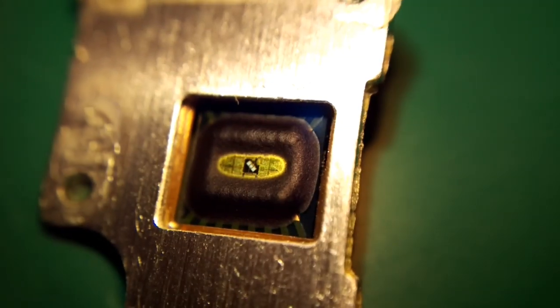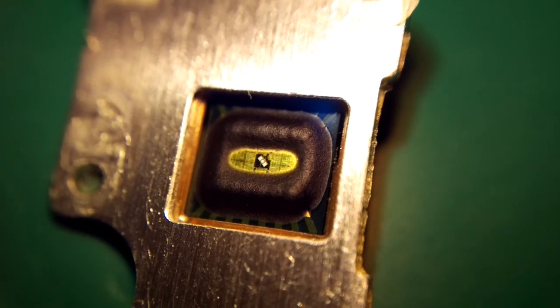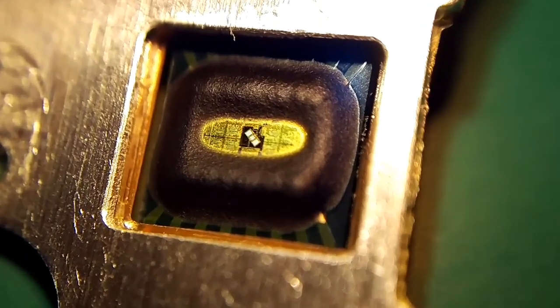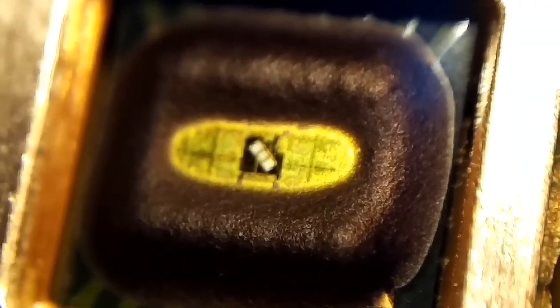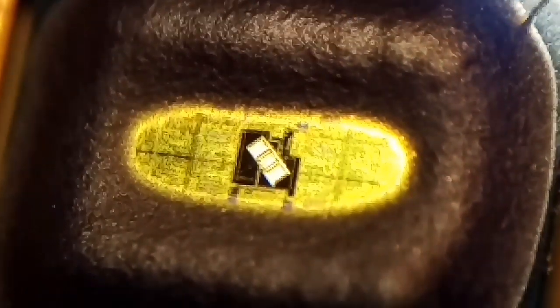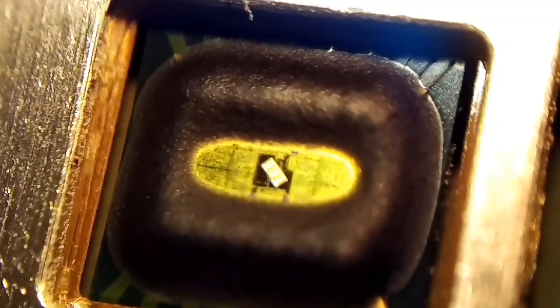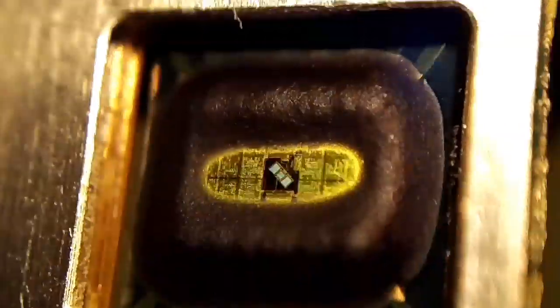Let's have a look at that strange chip. Okay, there we go. As you can see, there is a little structure at an angle. Now I assure you, to the naked eye, this is not visible. With a mobile phone you can always utilize your digital zoom, which on a video doesn't always have too much of a detrimental effect, because video is not all that many megapixels. I think I've overdone it a little bit because I can see it's getting grainy. But to some degree you can still have quite a decent image. So there we go.